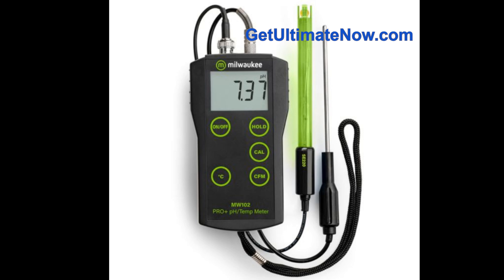It's all about respecting the tool and understanding the science behind it. As for the actual measurement process, it's pretty simple: dip the probe in, give it a little stir to ensure the liquid is evenly distributed, wait for the reading to stabilize on the display, and the meter does the rest — converting electrical signals from the probe into a pH value.